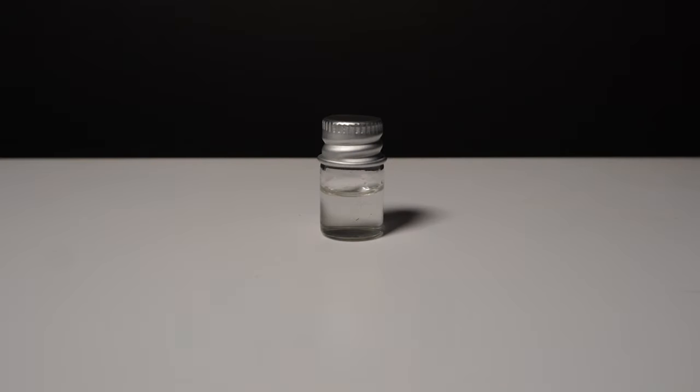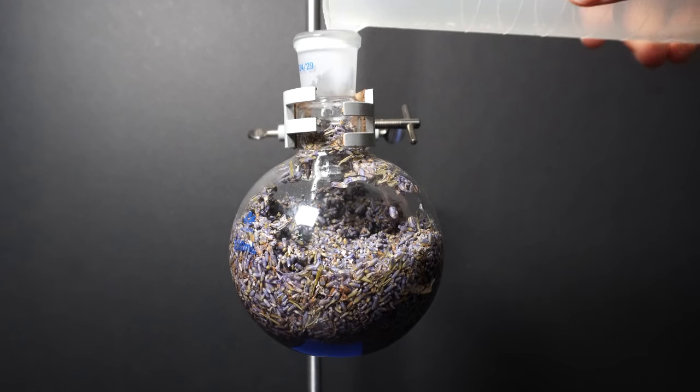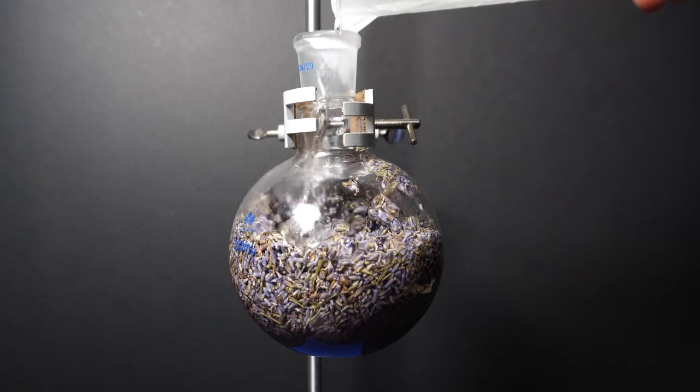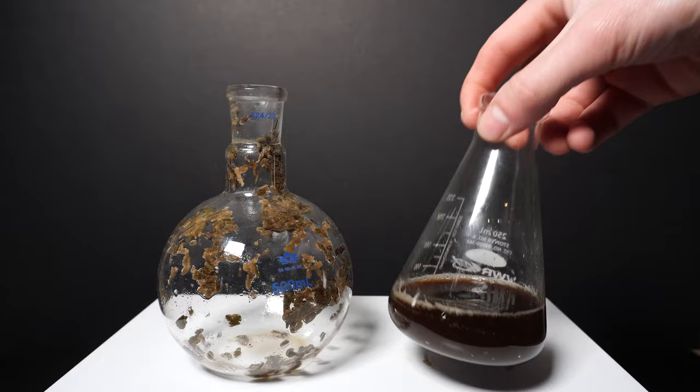In today's video we're going to extract lavender oil with the process of hydro distillation, then I will refine it down into pure oil. This oil can then be used as a scent profile for perfumes, cosmetics and more. I however will be attempting to make a basic scented sanitizer.